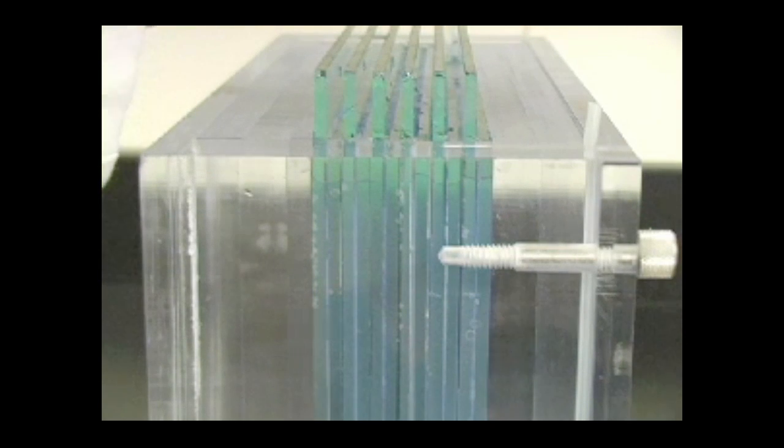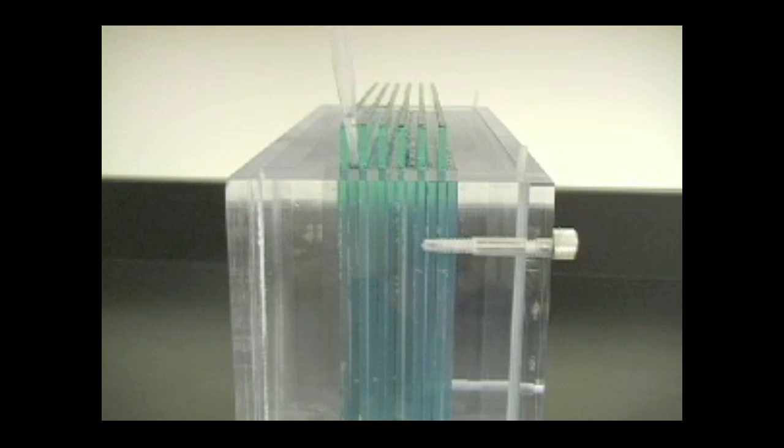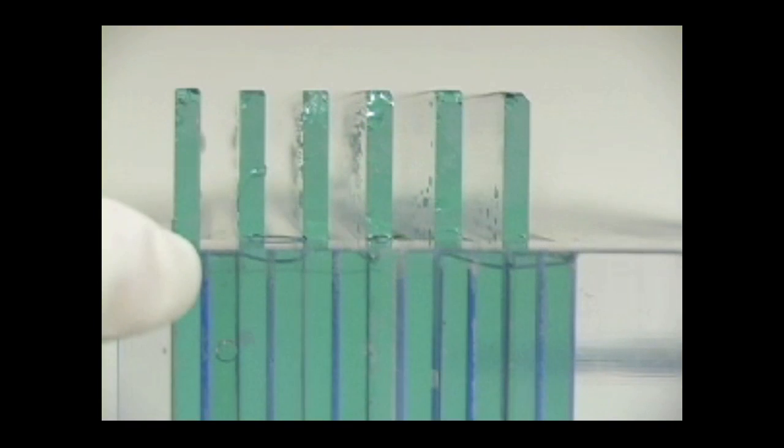Overlay each gel as quickly as possible with the same volume of water-saturated butanol or tert-amyl alcohol.